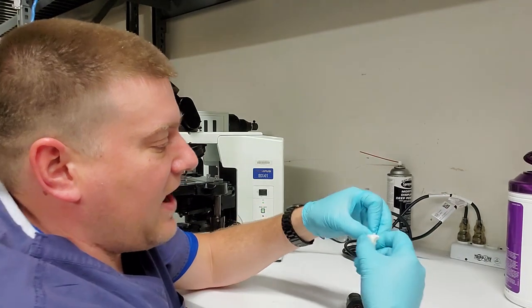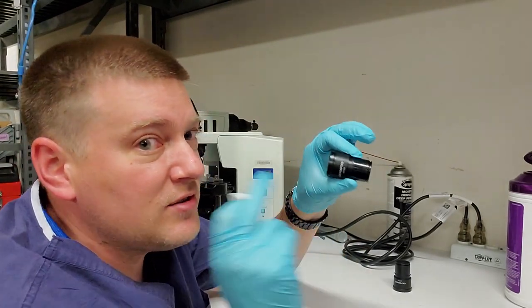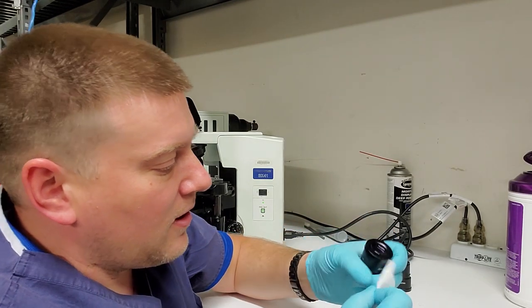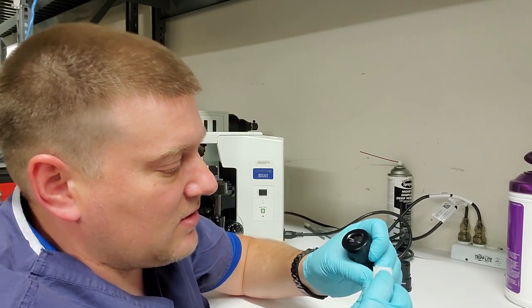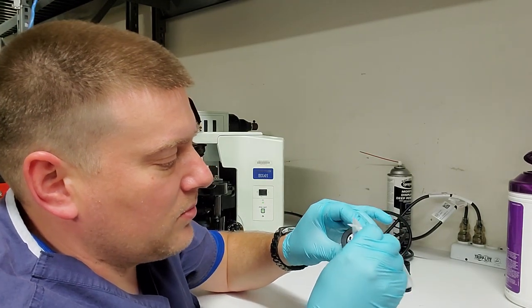And I'm going to attack the outer surface, not the inner surface. Again, it's recessed. It is a pain. Do not shove nothing down in there if you don't have to, okay? We're just worried about cleaning the outer surface of the ocular, which is the piece where the eye goes in. This is the dirtiest piece on the entire microscope, guaranteed. So I'm going to use a piece of my Zeiss wipe.